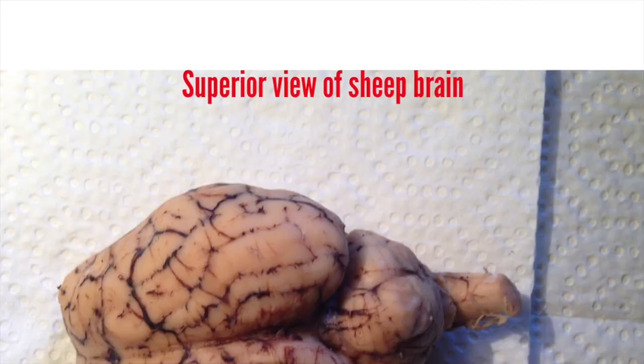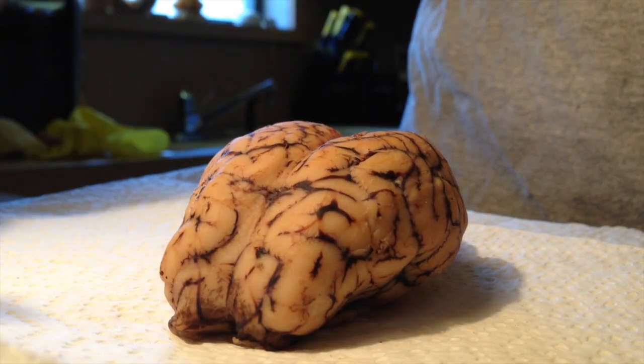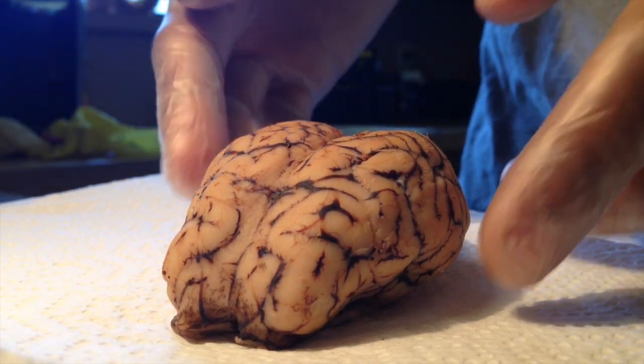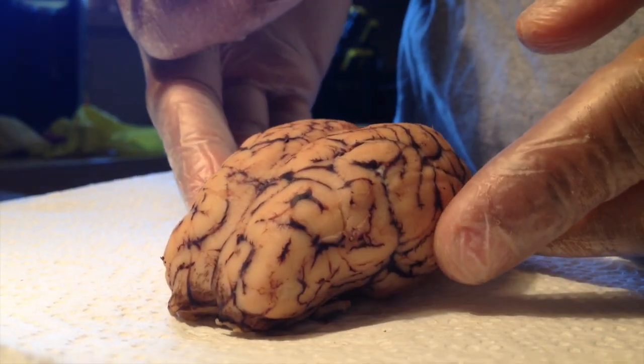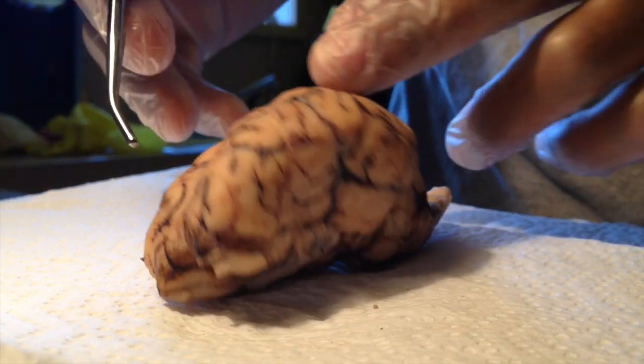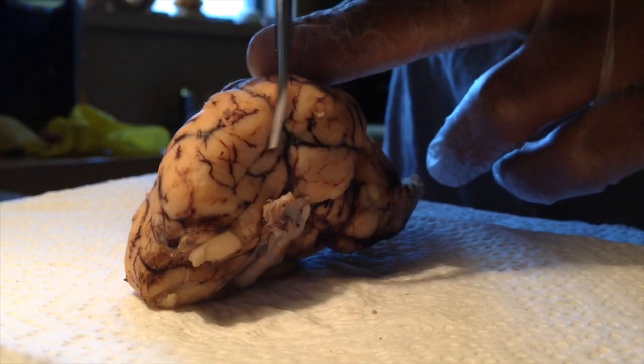We're doing a dissection of a sheep brain today, lab practicum 4 for Dr. P. And we're going to start with the superior view. The meninges, which has the dura mater, arachnoid mater, and pia mater. And here we're looking at the superior view of the sheep's brain. First, we're going to start with the lateral fissure, which is this area right here.